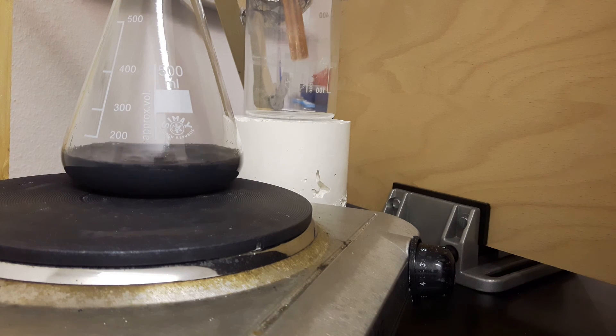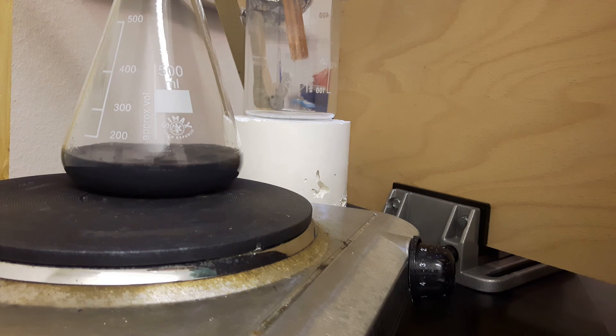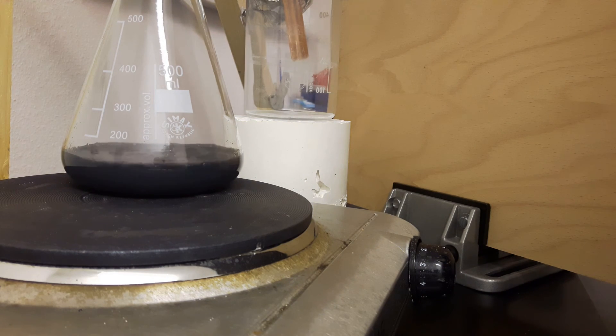And there's some white dust. And I suppose this to be aluminum isopropoxide vapors. I'm not sure what I suppose it to be. But since the temperature at this time is 82 degrees Celsius. I believe this is isopropanol. And now there's a lot of isopropanol that's coming over.